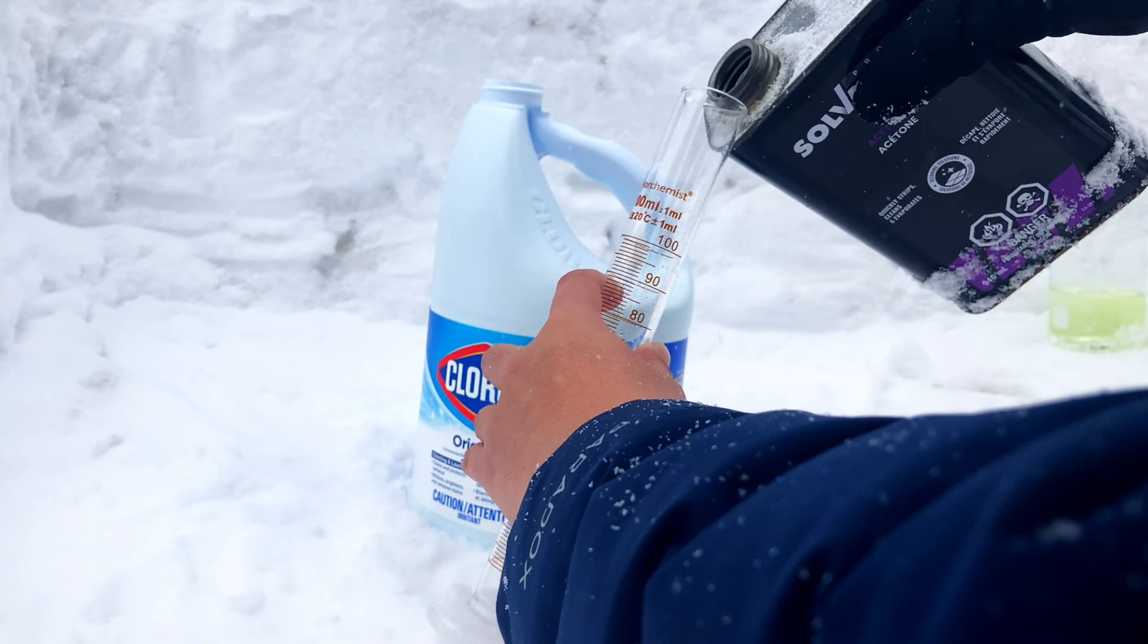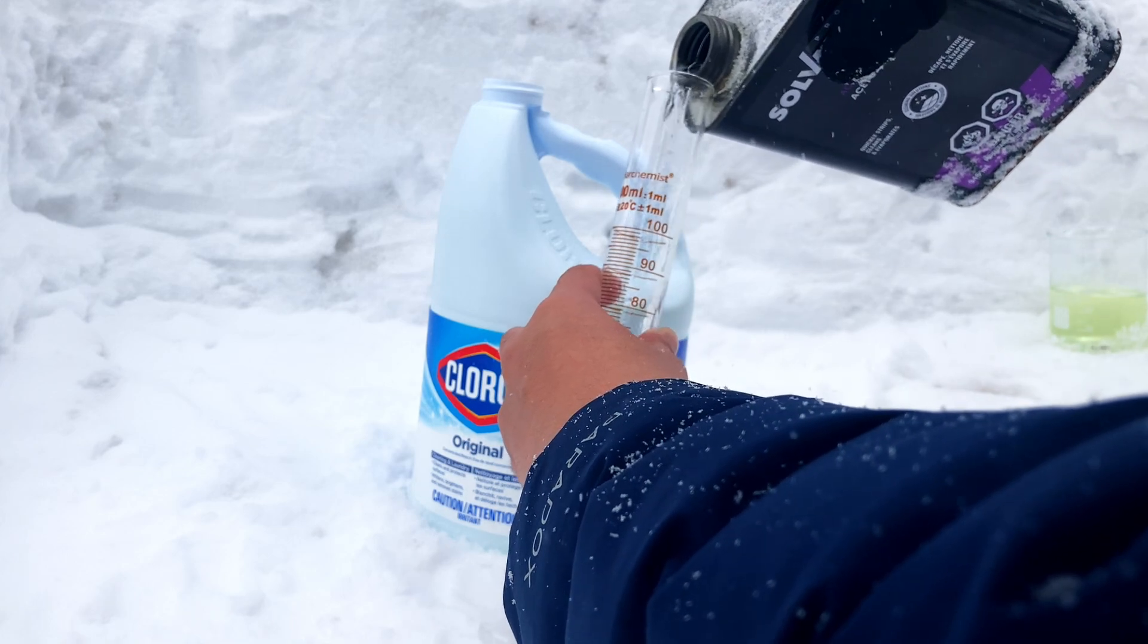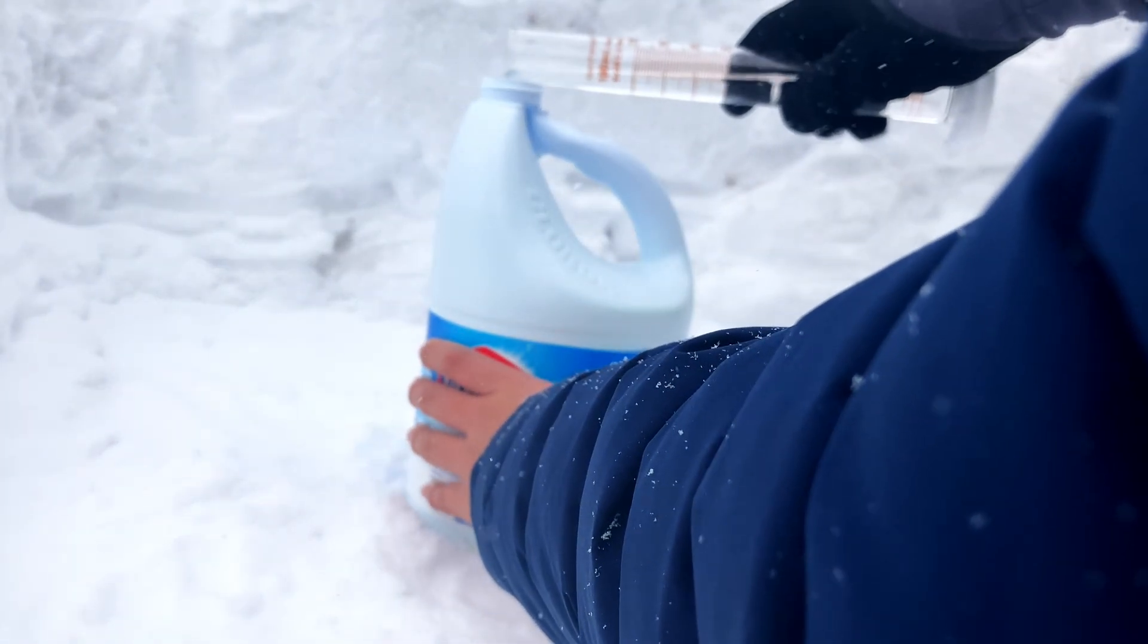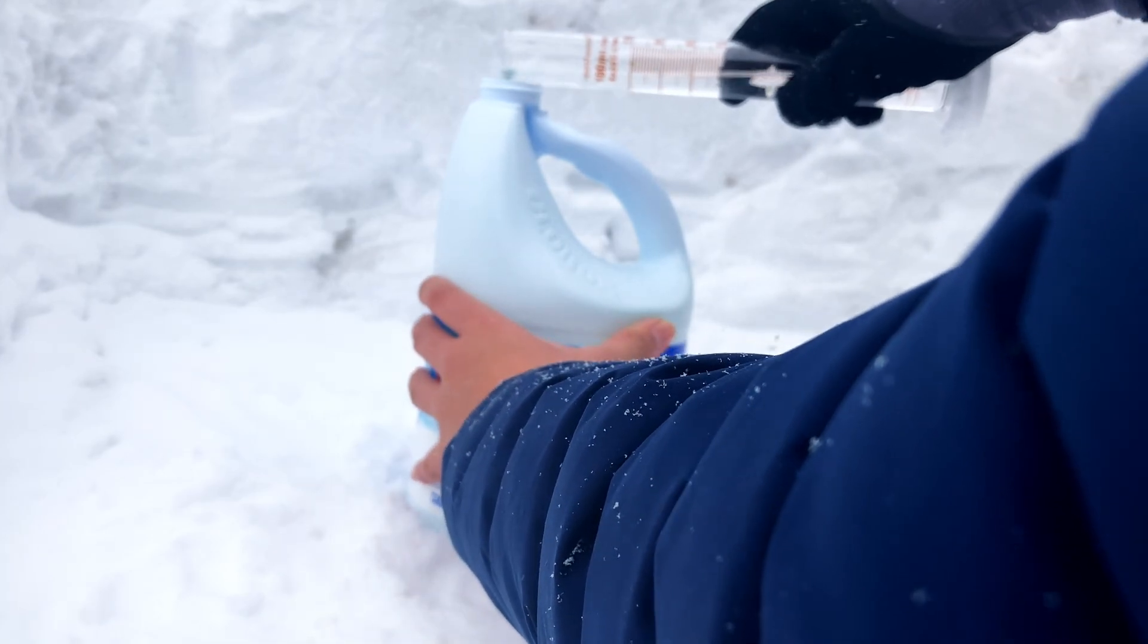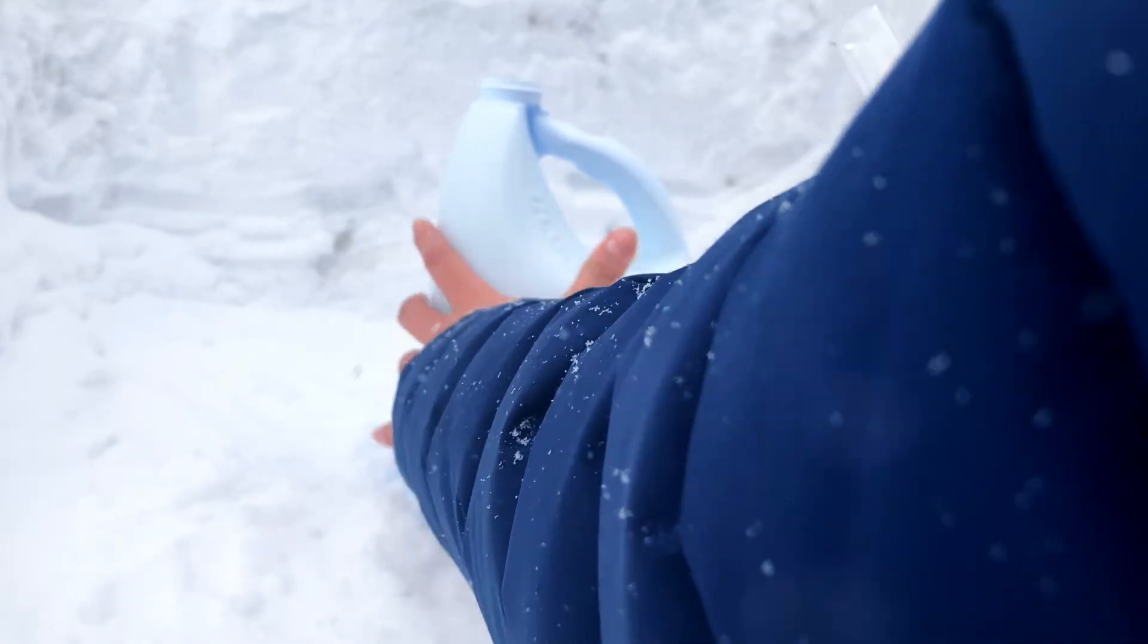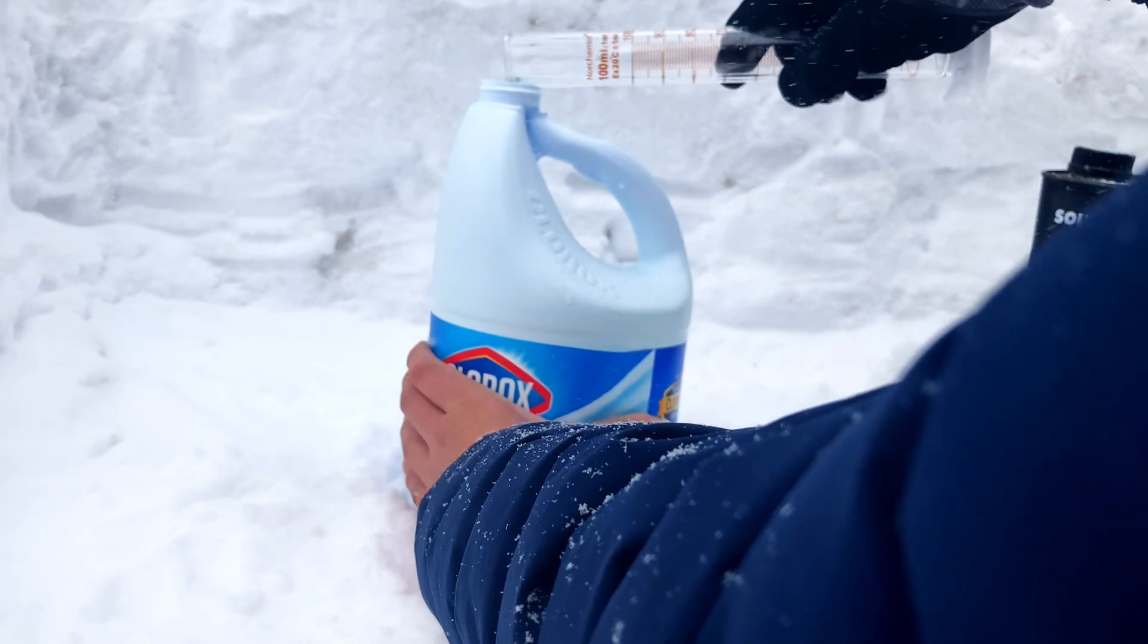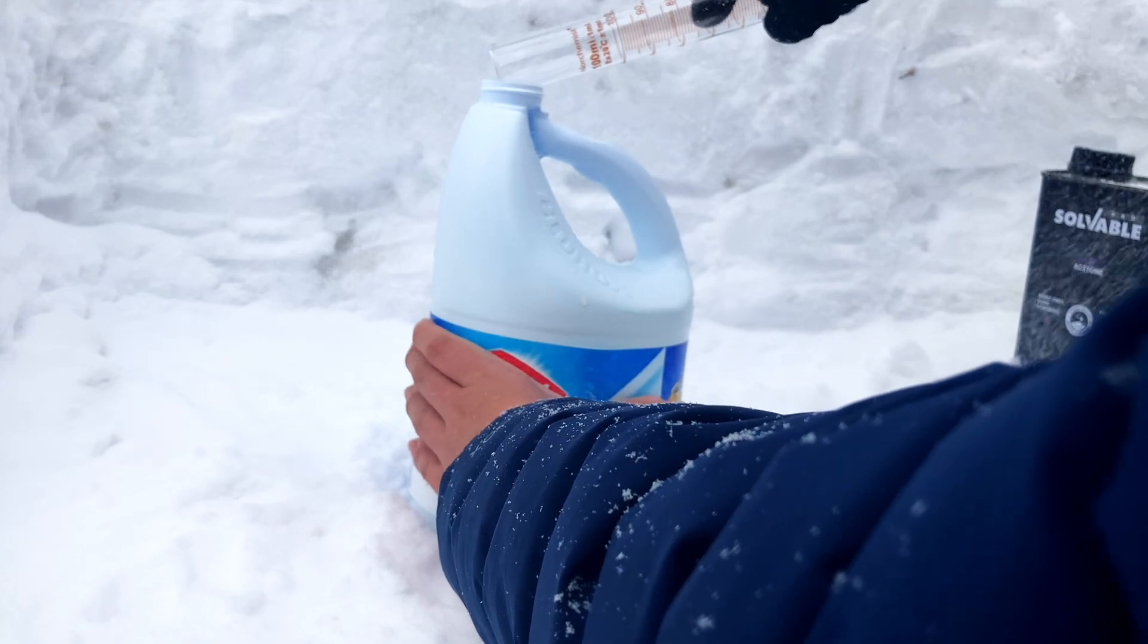I swear I just dropped the coldest chem calculation ever. Like literally, my hands are freezing. So grabbing my graduated cylinder, I poured in the 73 mils of acetone required. At first, I poured it in the bleach solution very slowly because I was afraid it was going to get super hot all of a sudden, but I barely felt any warmth. After dumping in the entirety of the acetone, it probably only heated up like 2 degrees or 1. Maybe it's because my bleach is slushy from the freezing temperatures and much of the heat released from the reaction was spent on the latent heat of fusion.